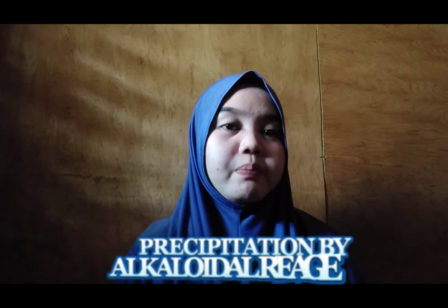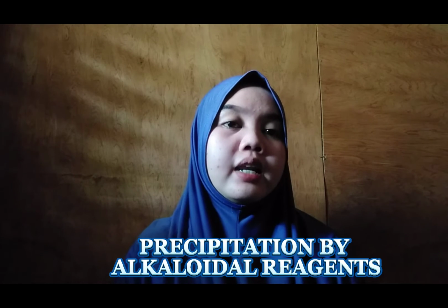Next is the precipitation by alkaloidal reagents. We have only one test, which is the picric acid. Procedure: put 2 ml of albumin solution in the test tube, then add 1 ml of picric acid solution, then observe. The result is the color became yellow but not including the upper part of the solution. Therefore, the denaturation by picric acid is evidenced by the cloudy materials.